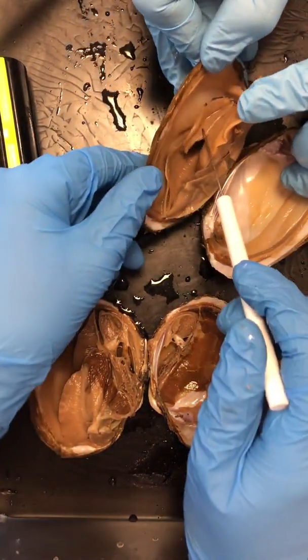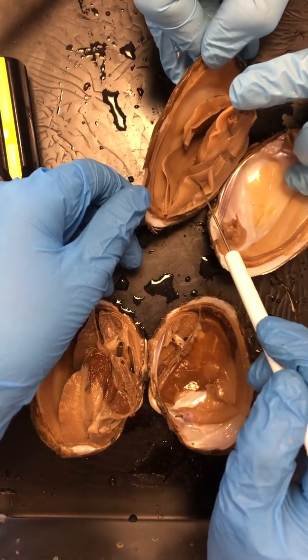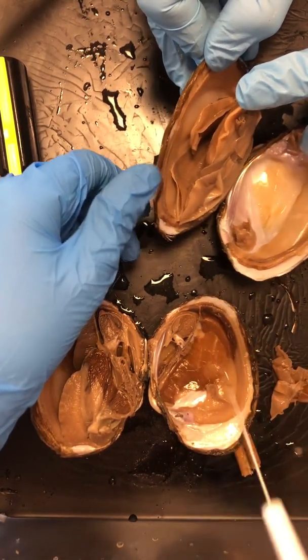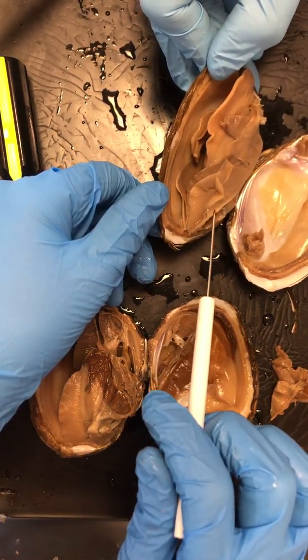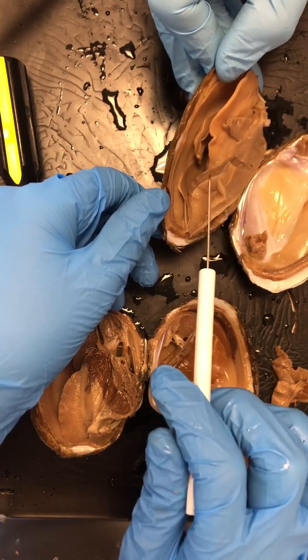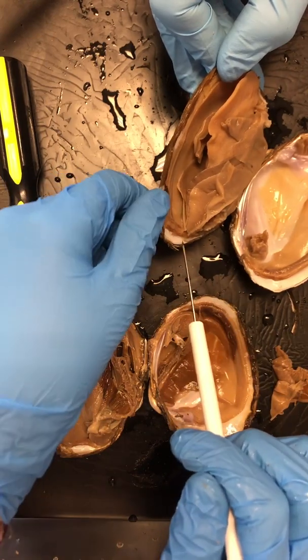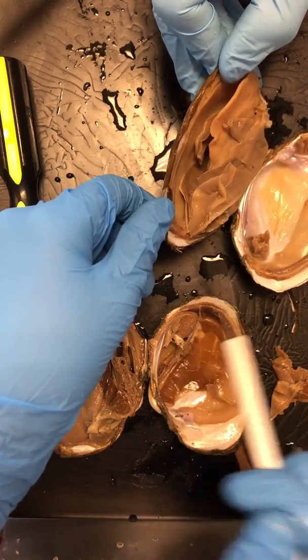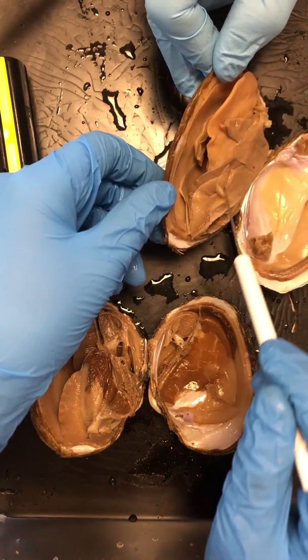Yeah, so you've got some here, here, and here. These are your gills, actually. So what happens is water comes into your mussel over this way, draws water over the gills, pulls out the oxygen, gas exchange happens, and then the water is shot out through the seam. Same side. Oh, I was wrong. It comes in over on this side. My bad, team. Water comes in over this way, travels across the gills.